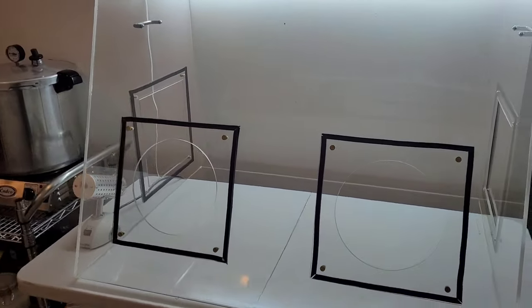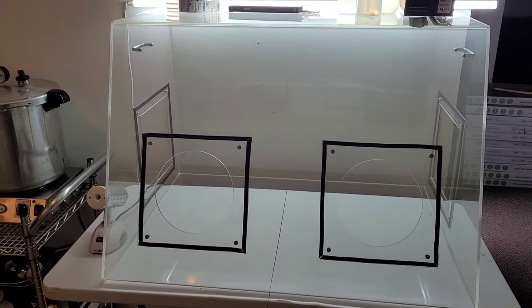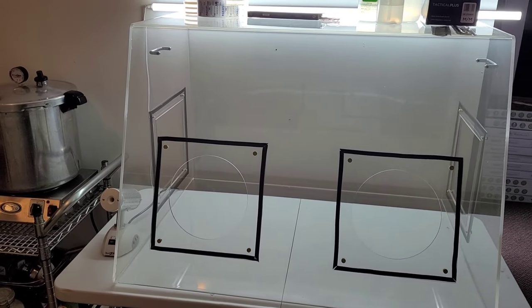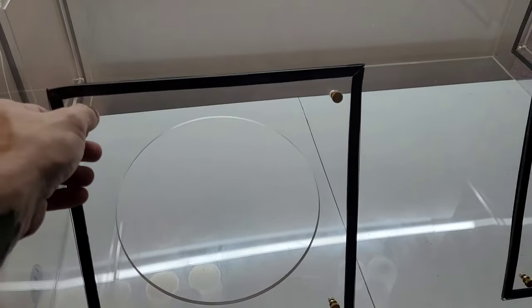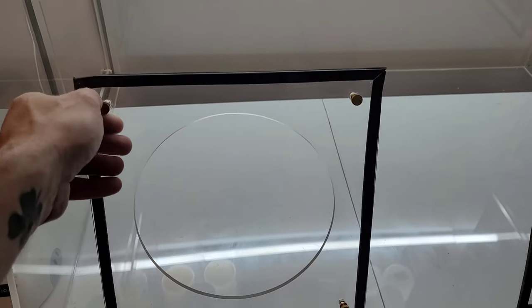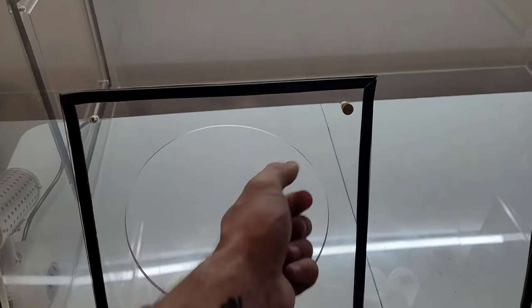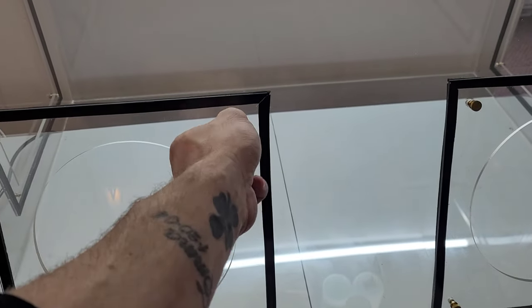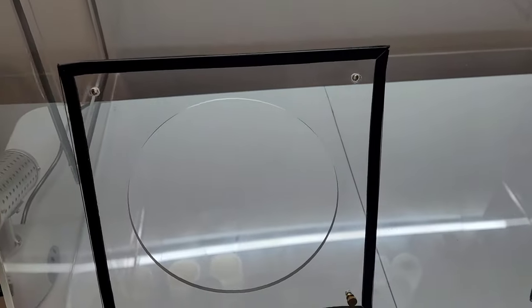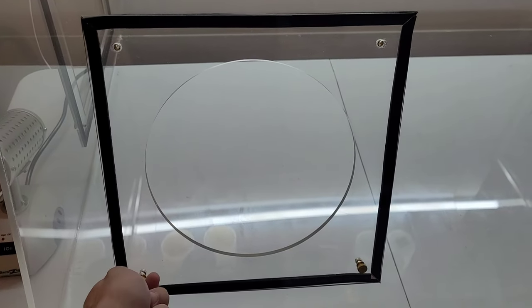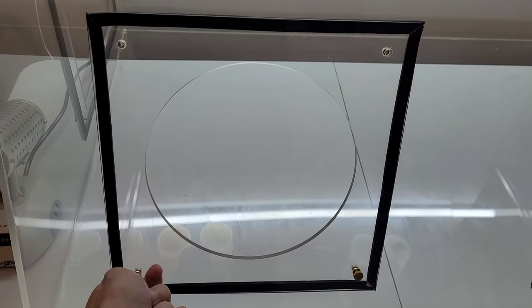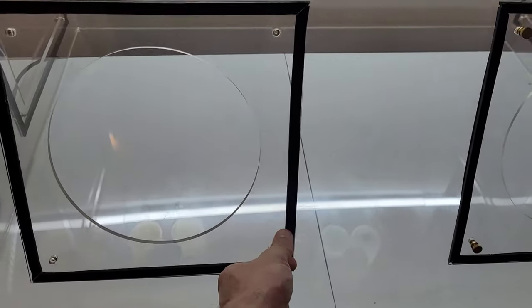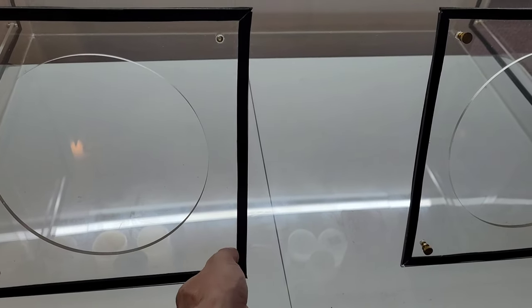I'm going to show you how to load this first and then go over the still air box basic theory. Now by now you've probably noticed that this isn't your standard still air box, but the principles remain the same. You may be using an upside down tote, and that's most likely the case. However, no matter the size, no matter the shape, it's essentially the exact same thing.